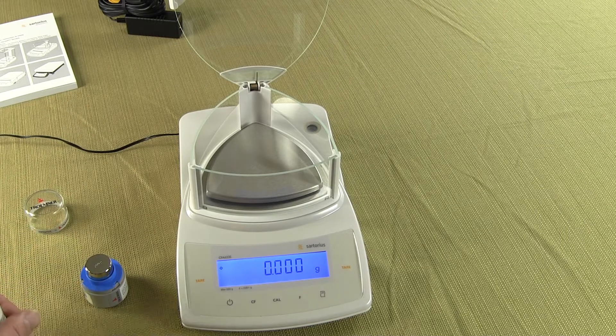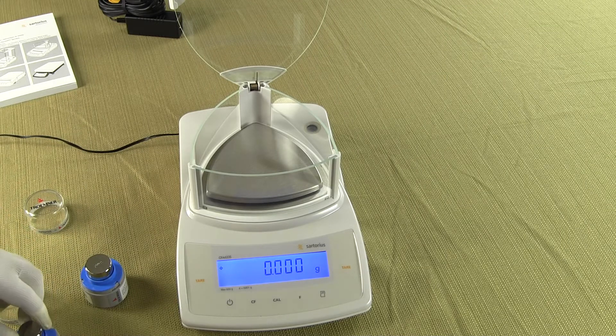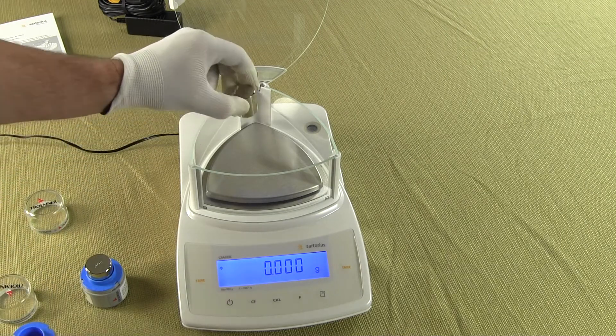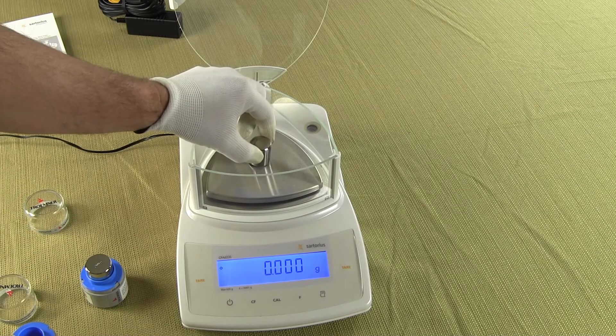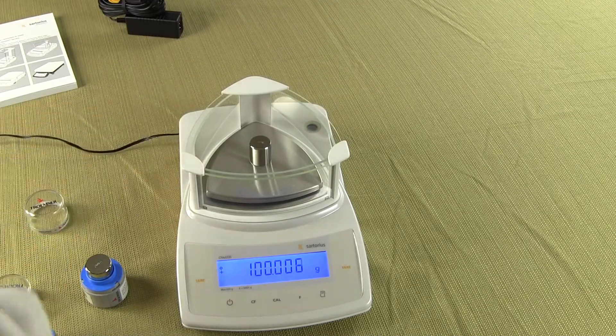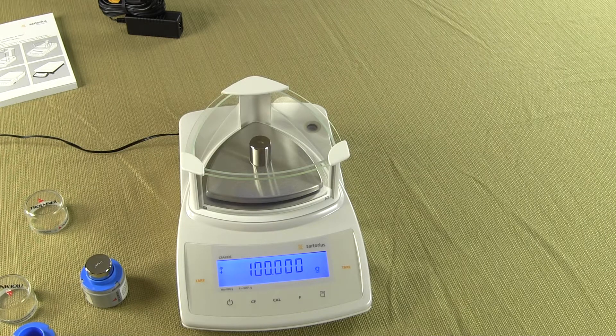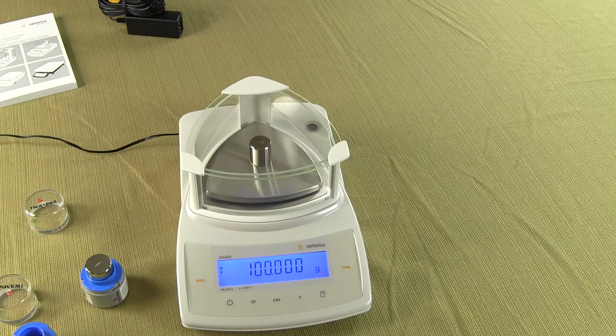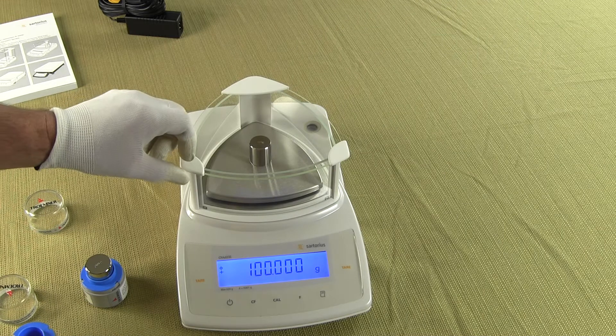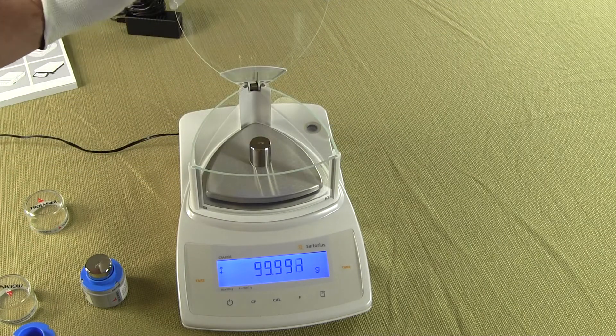And then I have a 100 gram weight here. This is a 100 gram. Place it on the center of the platform.